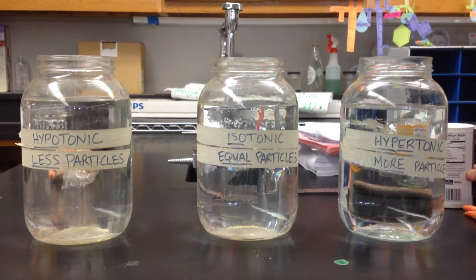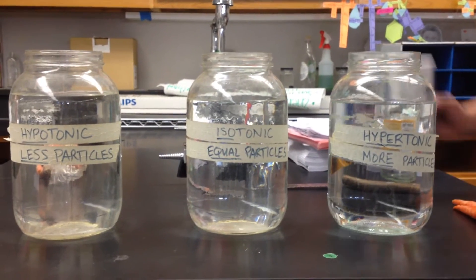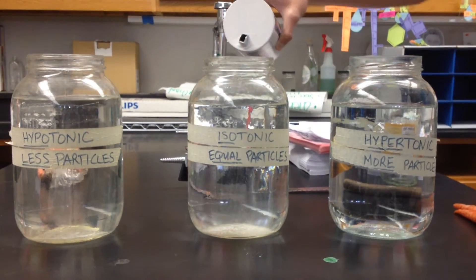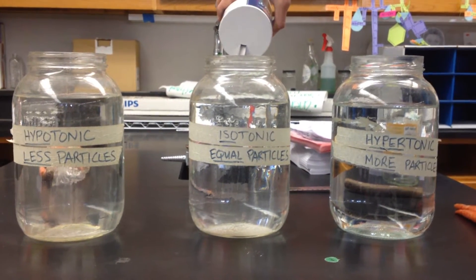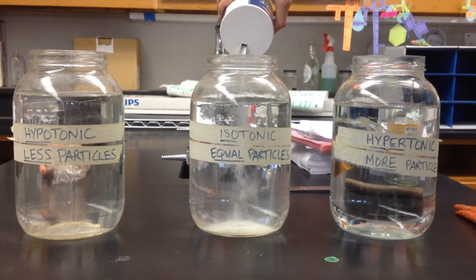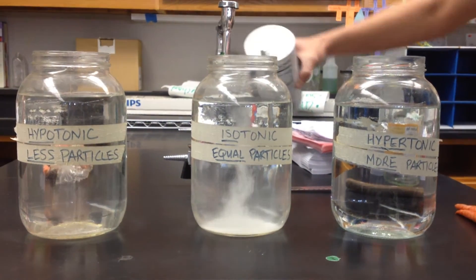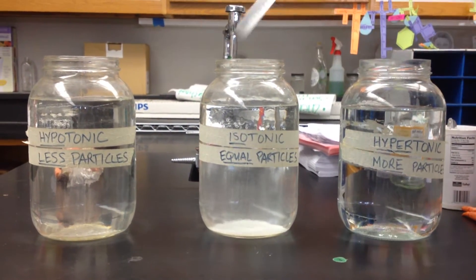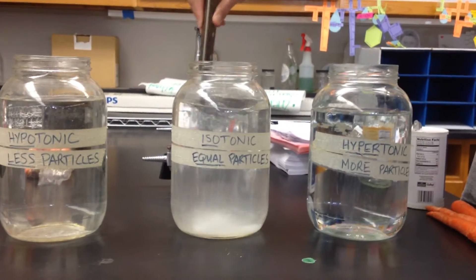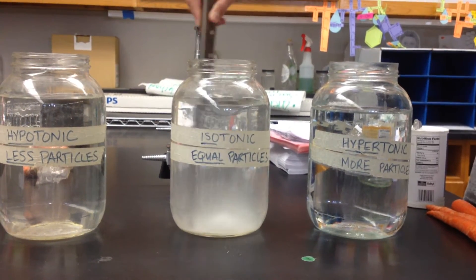The next one is isotonic, which means equal particles. We're going to add some salt to that container — a moderate amount — and then mix it up. Keep going, keep going. You can invert that whole thing upside down. Then we're going to stir that one up. We want to try to dissolve our salt into that container. It will slowly dissolve away even if you can still see a little bit of sediment on the bottom, but we'll come back and mix it again.